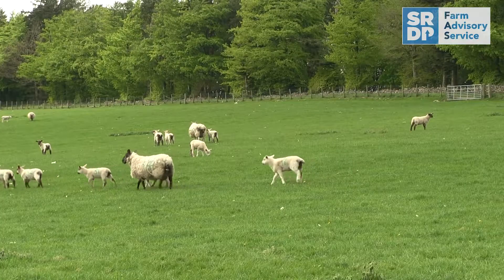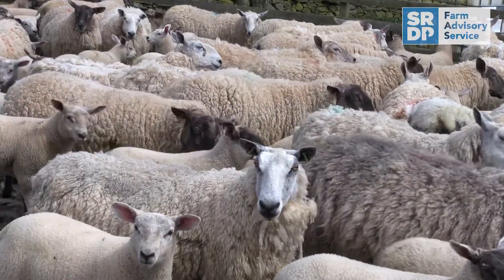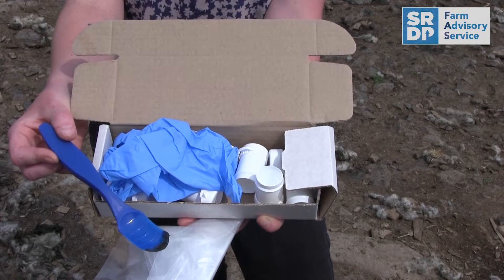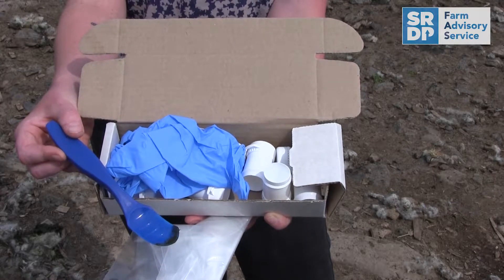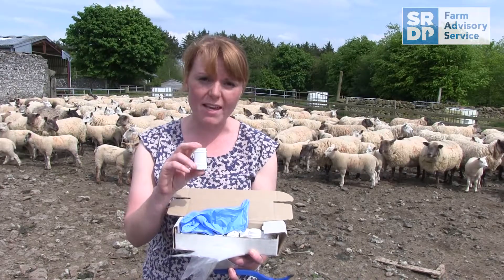In order to collect the sample, if you're in the field you'd gather the flock into a corner of the field, or if in the pens you gather them into the corner, let them stand there for about 10 minutes or so, and then collect any fresh dung samples. This is an example faecal egg counting kit — we've got 10 of these pots for each individual animal with the sample collected, some gloves, and some spatulas. The aim is to fill these pots entirely because if there's any air in the pots, that can cause the eggs to hatch.